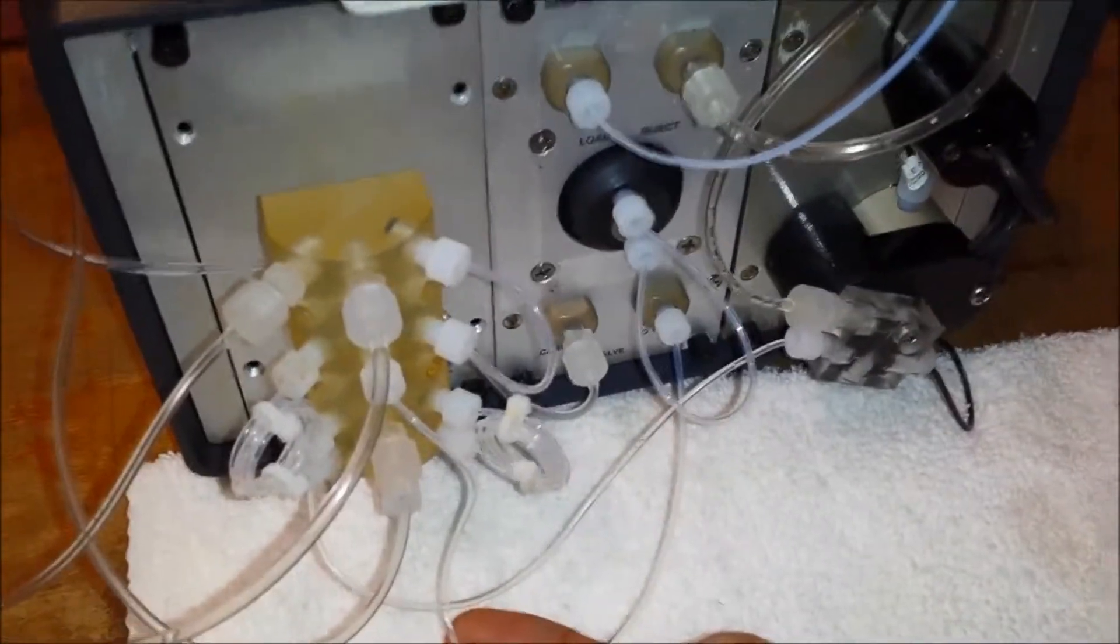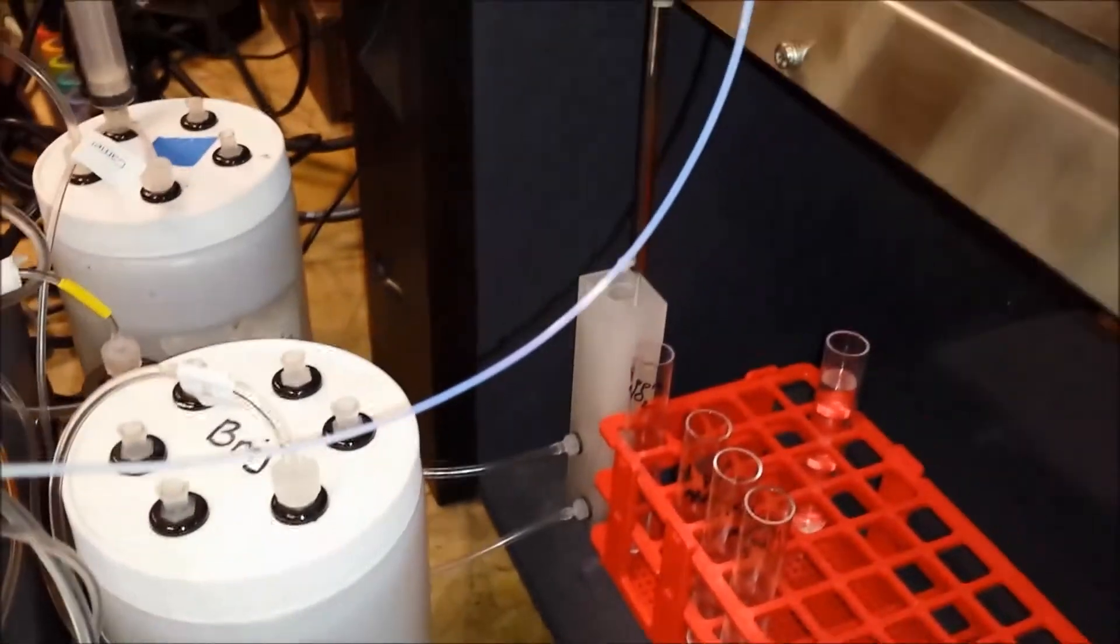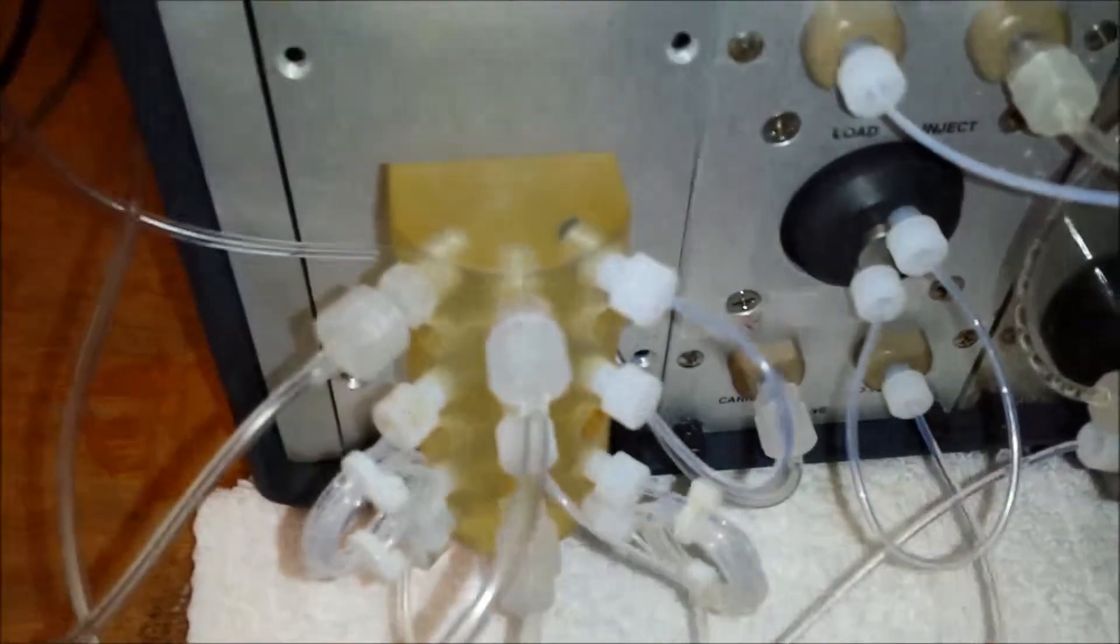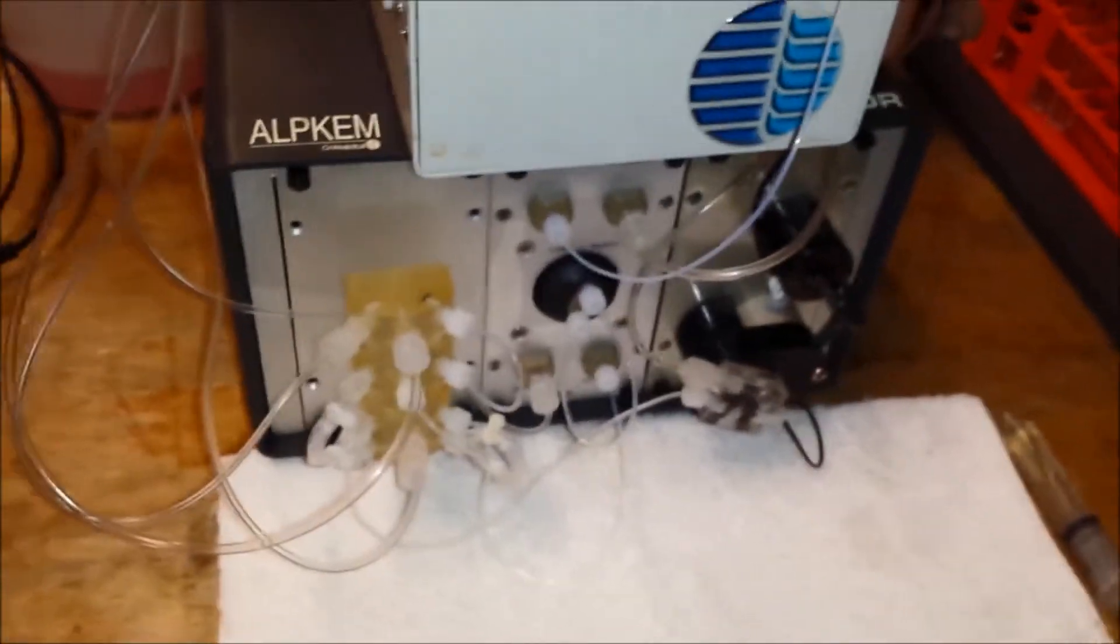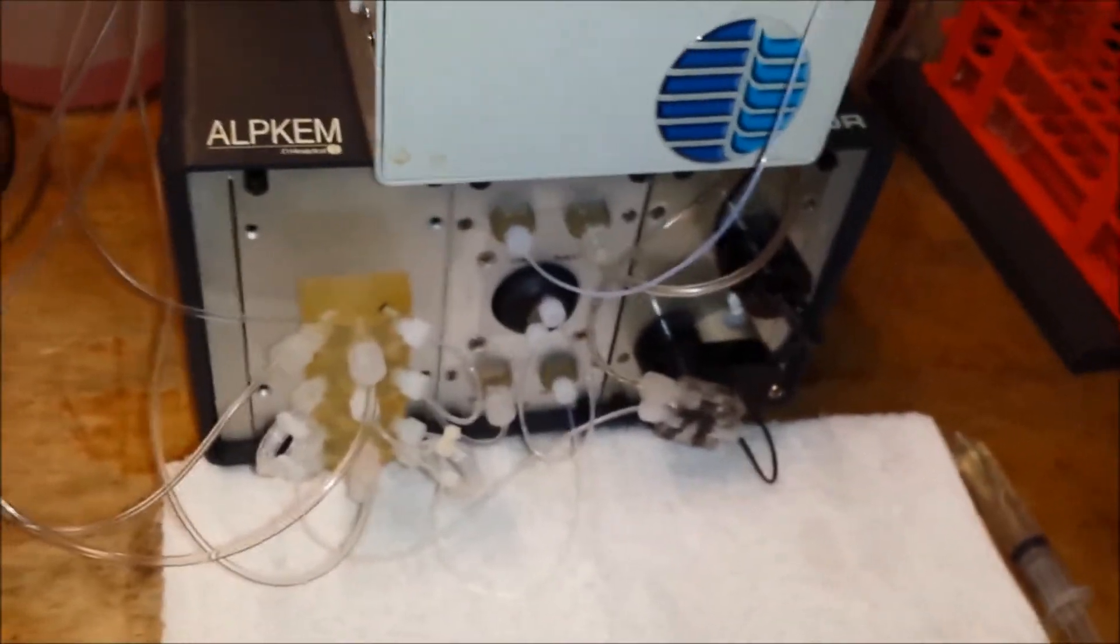And then you know for certain that sample is traveling all the way from the probe through the pump into the SISC valve and is actually coming into the cartridge. And you can be assured that there's not a problem with a valve or the tubing or the pump tube that's pulling the valve connection.